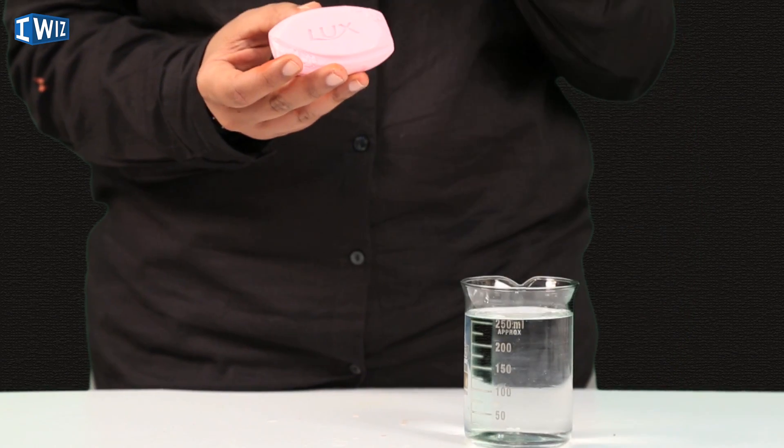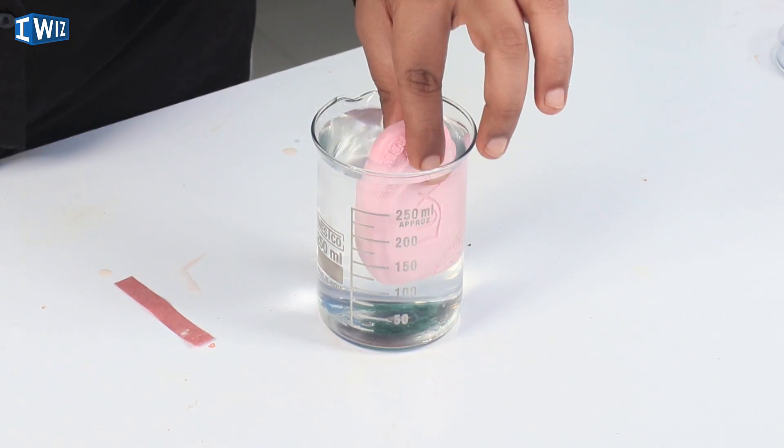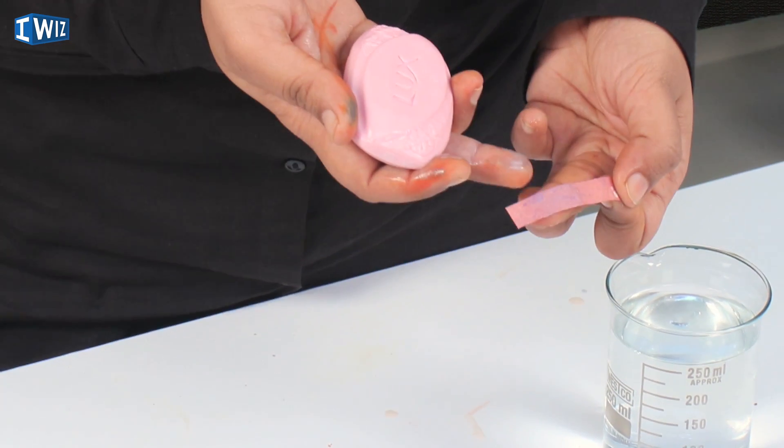Bases are slippery, but I have a dry soap here and it doesn't seem slippery to me. If I rub red litmus on it, there is no color change. But if I dip the soap in water, it becomes quite slippery, and now when I rub the red litmus on it, parts of it turn blue. This shows the importance of water — until and unless there is water present, bases do not produce any OH⁻ ions. So water is extremely important for bases to release their OH⁻ ions.